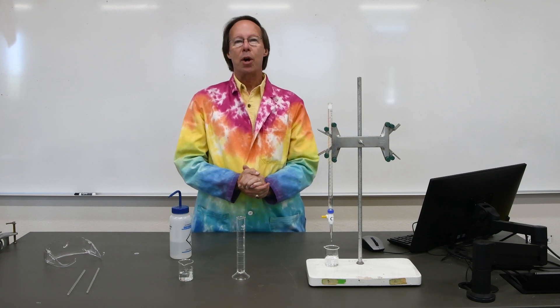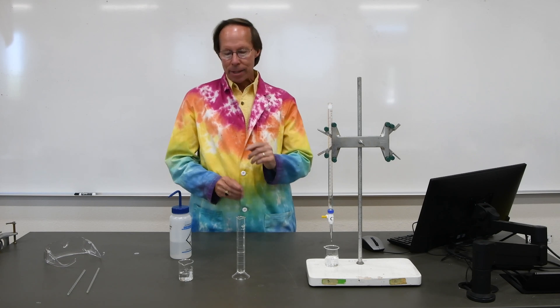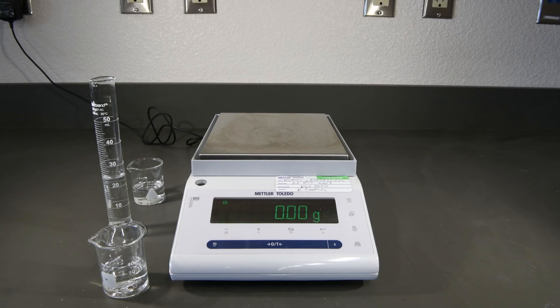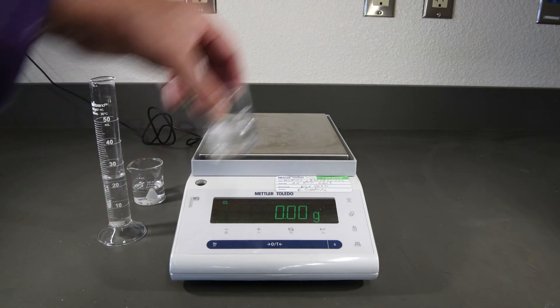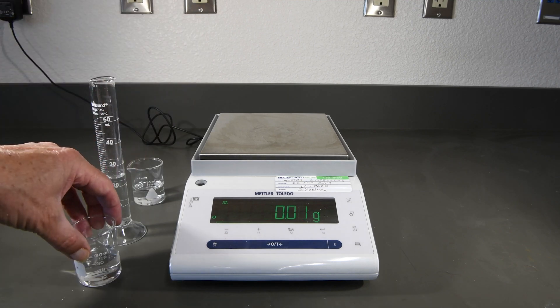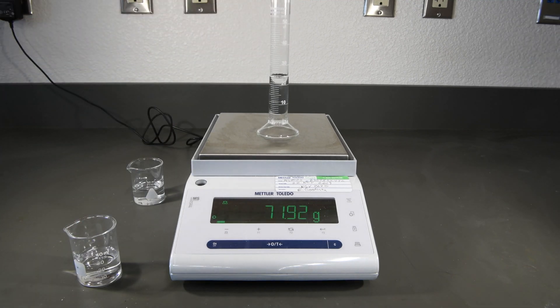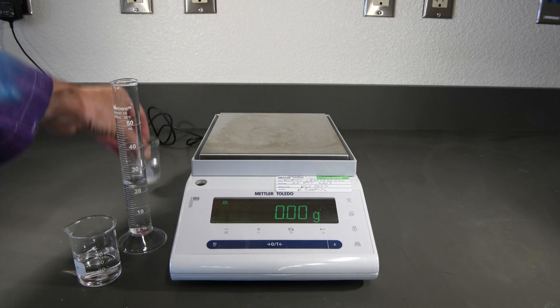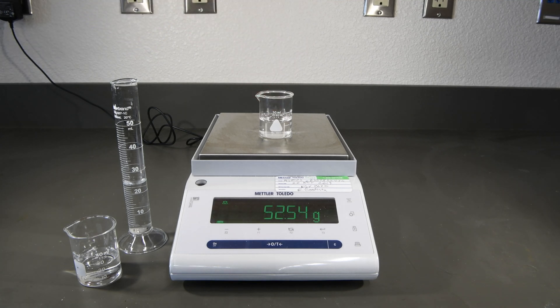Let's go ahead and take our three containers now and weigh them with the water, then subtract those initial masses and see how close each came to 23.36 grams. Now let's measure the masses of water in each of our three containers. The beaker we measured the water directly into comes out to about 51.47 grams. The graduated cylinder has a final mass of 71.92 grams. And the water we collected from the burette comes out to be 52.54 grams. Now subtract these final masses from the initial for each of our three measuring devices and determine which was the most accurate and which was the least accurate.